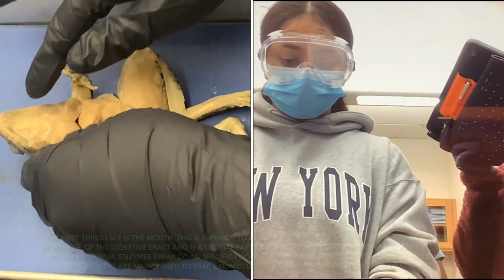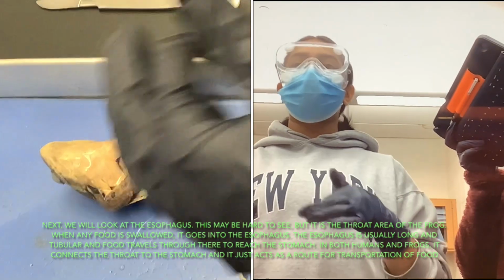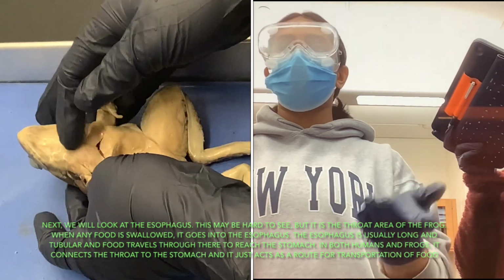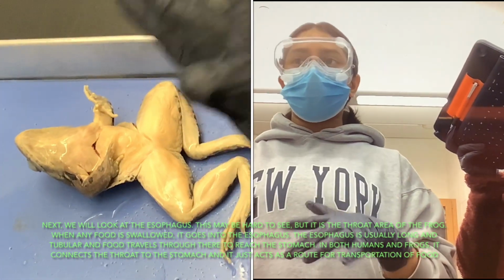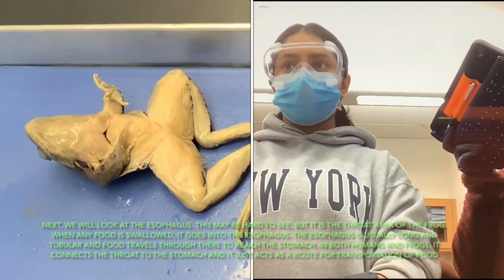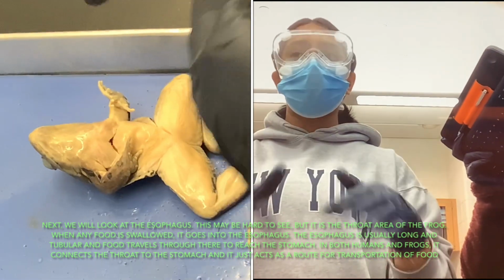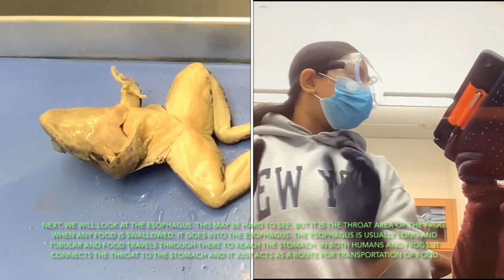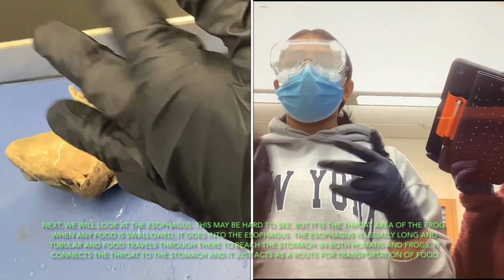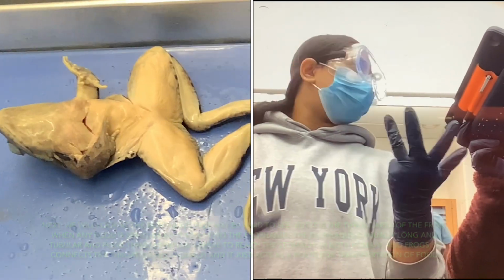And then next, we look at the esophagus, this part, and it's basically like the throat area. It may be hard to see, but like I said before, it's the throat area of the frog. When any food is swallowed, it goes into the esophagus. The esophagus is usually really long and tubular, and food travels through here. It is basically a passageway from the mouth to the stomach, connecting the throat to the stomach, and it acts just like a transportation route for food.